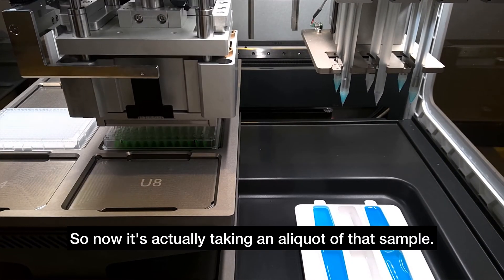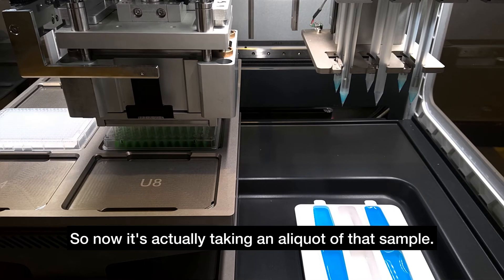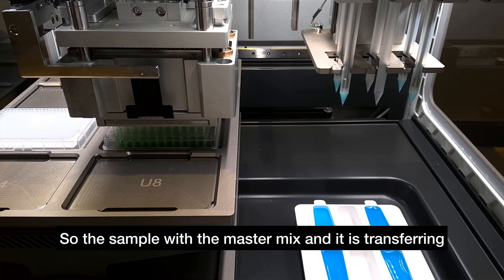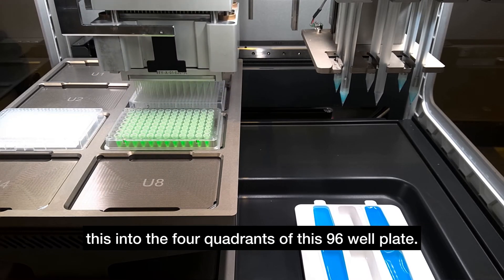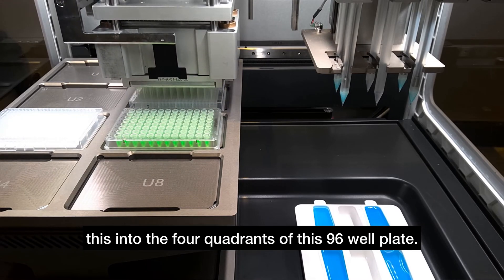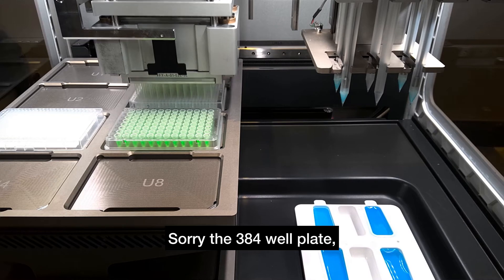Now it's taking an aliquot of that sample with the master mix and transferring this into the four quadrants of this 384 well plate.